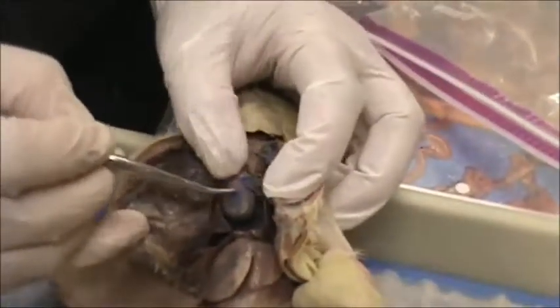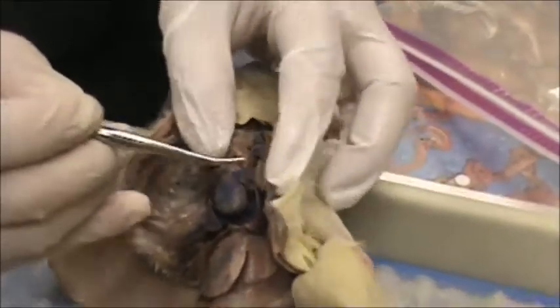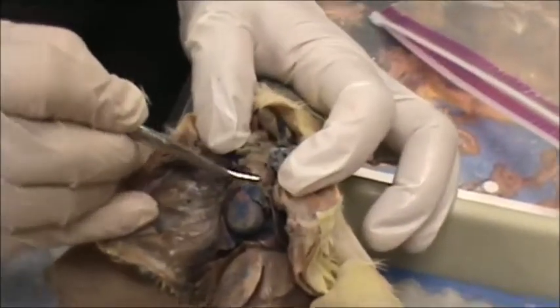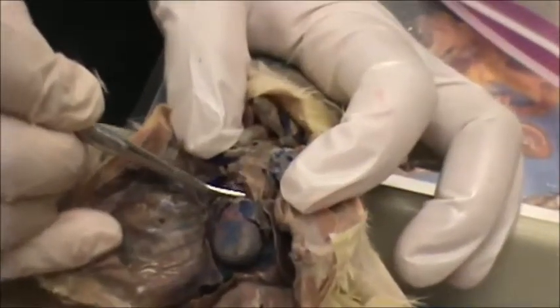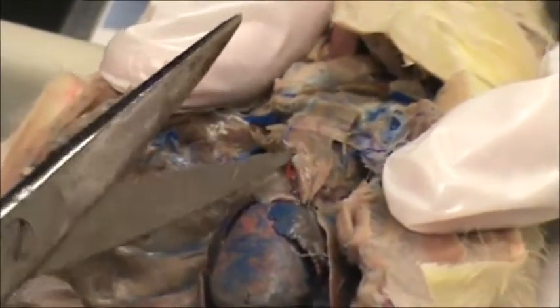On the outside of the heart are the atria. Sitting on top of the heart is the thymus gland, and the thymus gland matures white blood cells — the T cells mature in the thymus. And I'm just going to cut open the sternum so you can see it a little bit better.